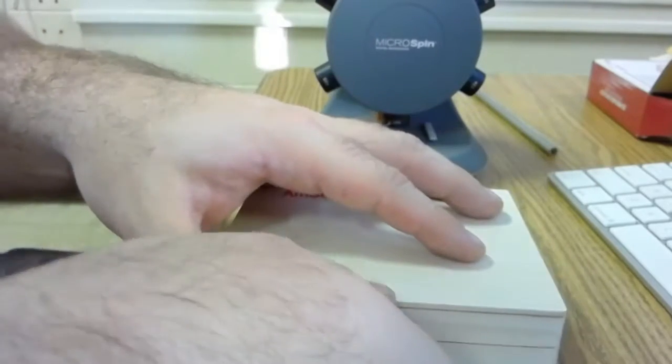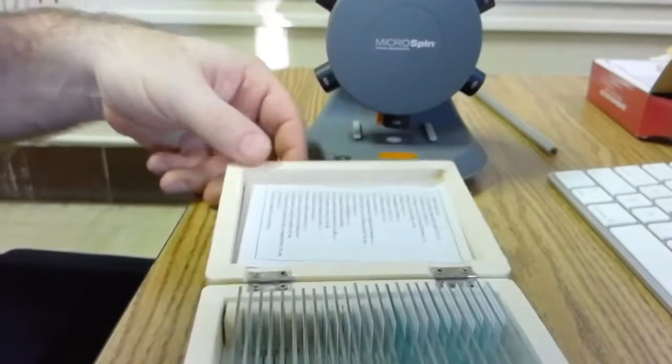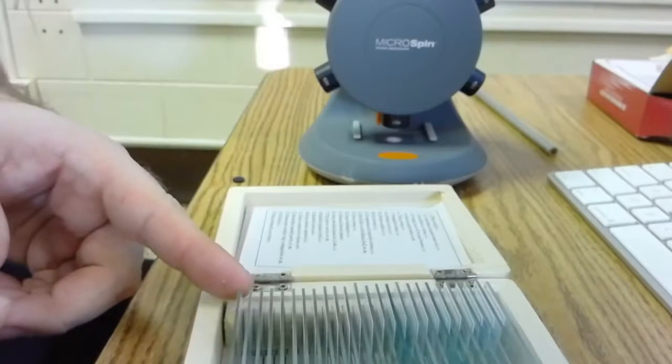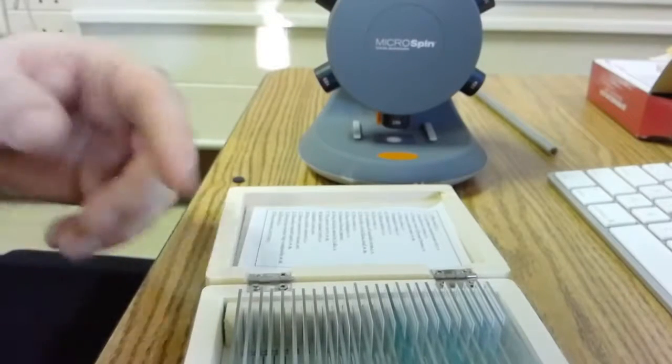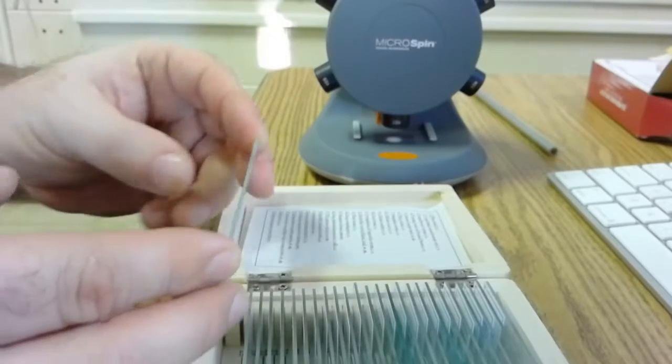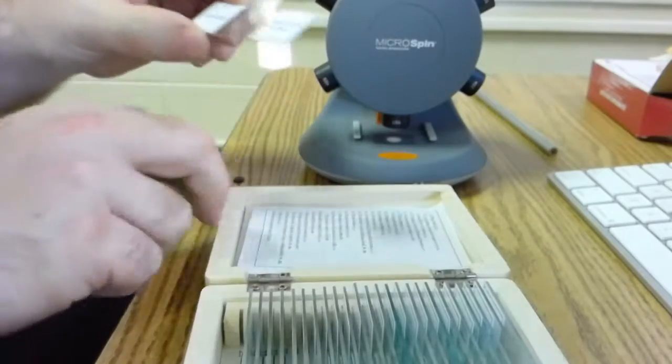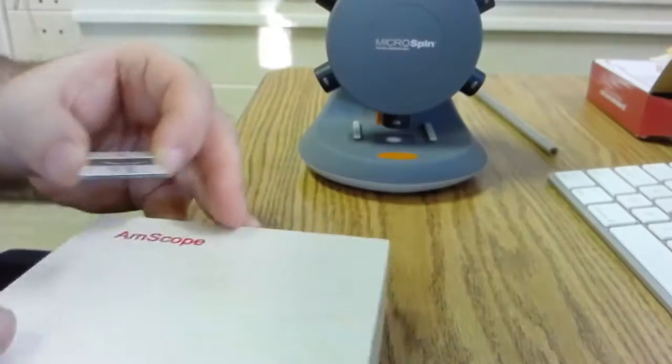You open the case. Be very gentle. And you always want to make sure you're picking up slides by these edges. So I'm going to choose a slide. Notice my fingers are holding them by the edge. You never want to put your fingers over the slide. We do not want fingerprints that will obstruct your viewing through the microscope.